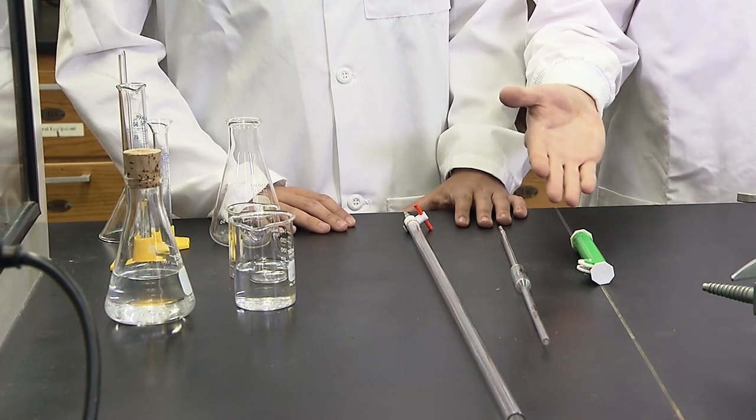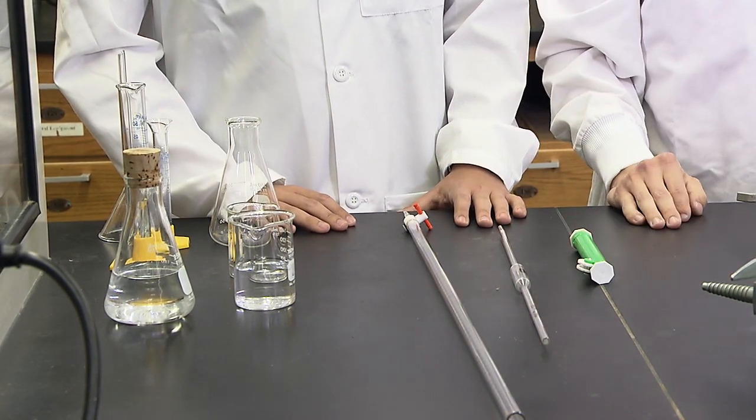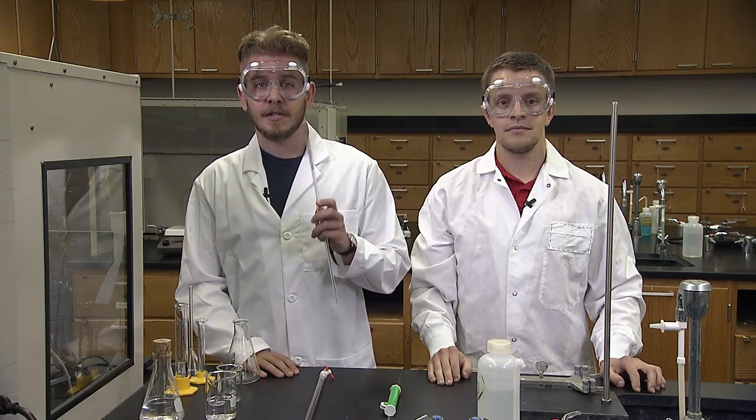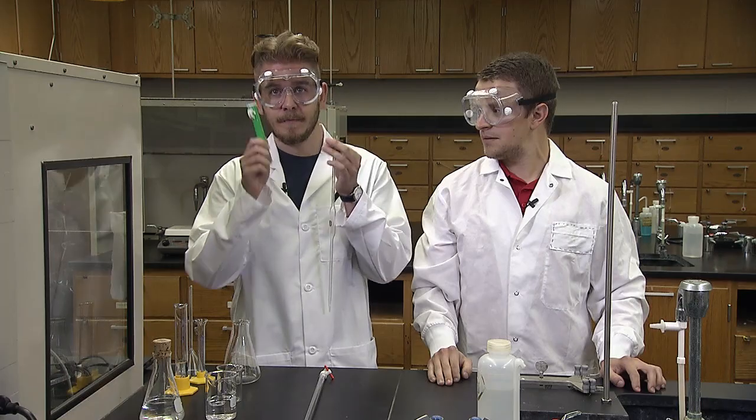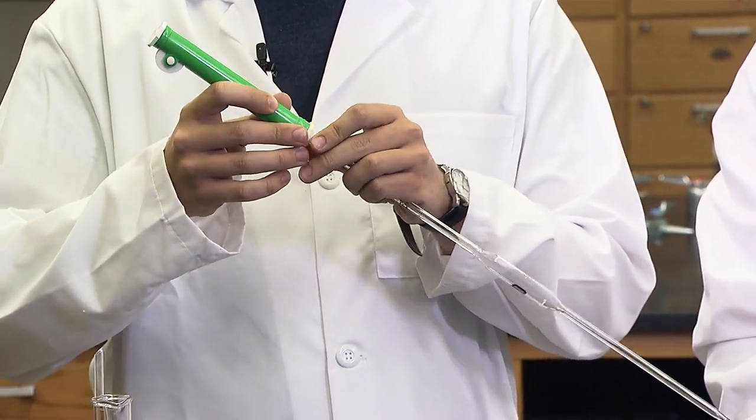Get a burette, pipette, and pipette pump from the cart. The pipette is cleaned with water and conditioned with reagent before using. Remember to hold the pipette firmly at the top when attaching the pipette pump. See the how-to pipette video for more detailed instruction.